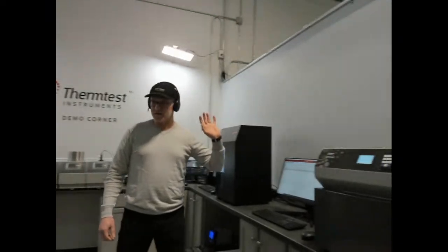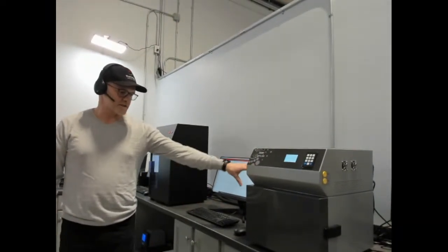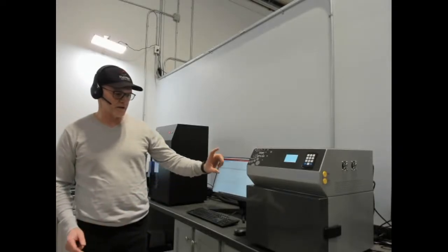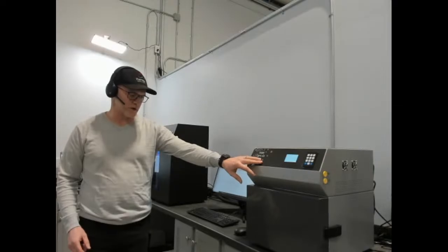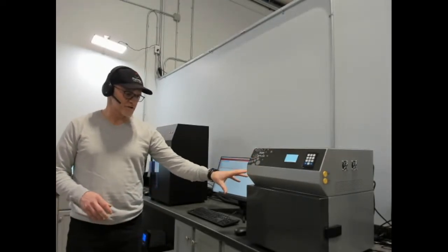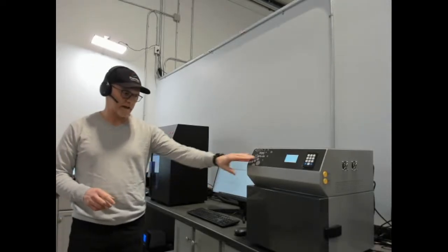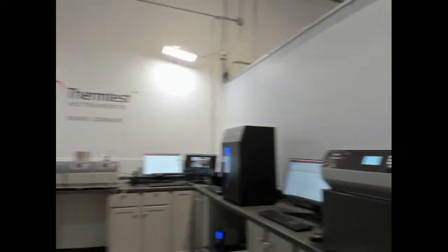And our big brother to the HFM-25, which is the HFM-100. This covers much larger samples of 300 millimeters by 300 millimeters by 100 millimeters thick, thus the name HFM-100. And then we have an HFM-50, which is a smaller version of this. It looks identical, just smaller, which has maximum dimensions of 200 by 200 by 50. So the numbers after the hyphen are the thickness range, the maximum thickness.